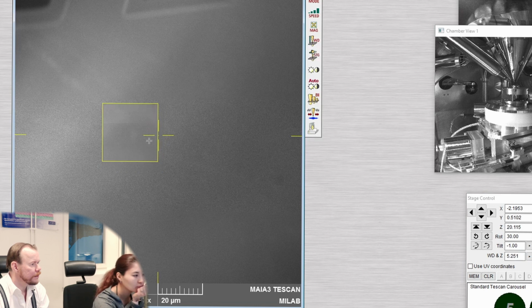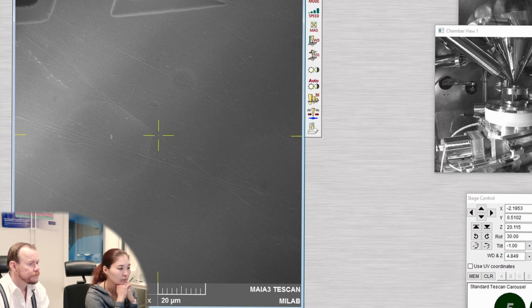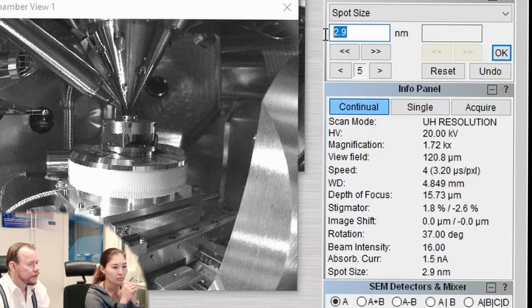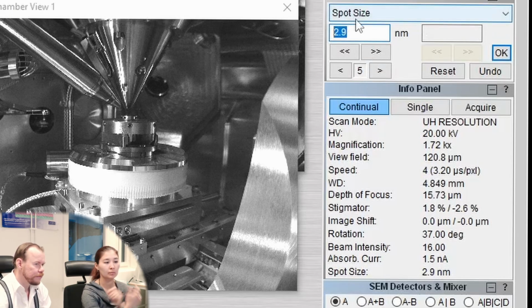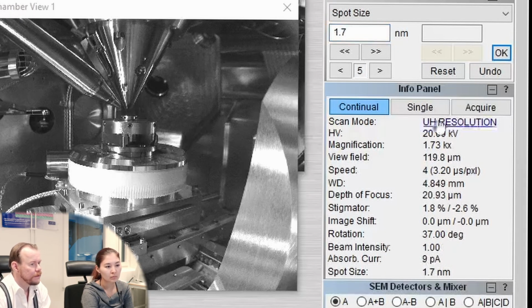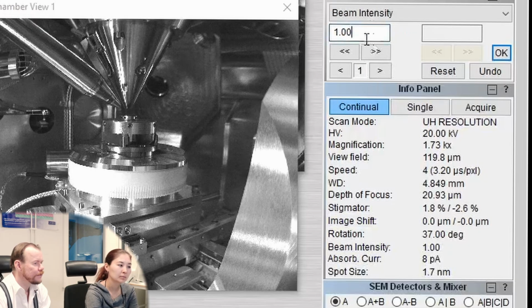Can focus on that little dot there, perhaps. So now we see we're on 2.9. And let's see what the smallest spot size we can get is. What beam intensity corresponds to the smallest spot size? 16 intensity gives 2.9. But we can ask the machine to tell us what beam intensity is the optimum. And then we see in this case, beam intensity 1 gives 1.7. So it can fluctuate. Last session, we were at a higher number. But 1 is a very low intensity also.